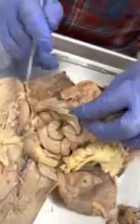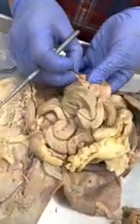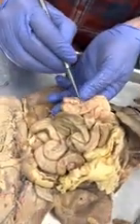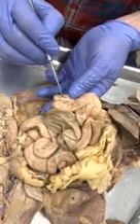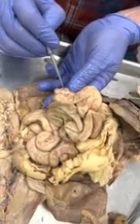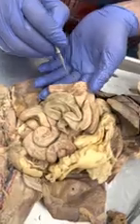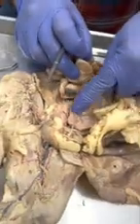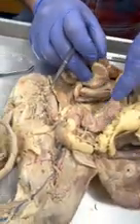If we go back to the large intestine, we see this little part of the large intestine coming off. There's the ileum there, it goes in right there, the ileocecal valve. That's the cecum right there. So this is the ascending colon this way. There's a transverse colon, and then this is the descending colon. Okay.